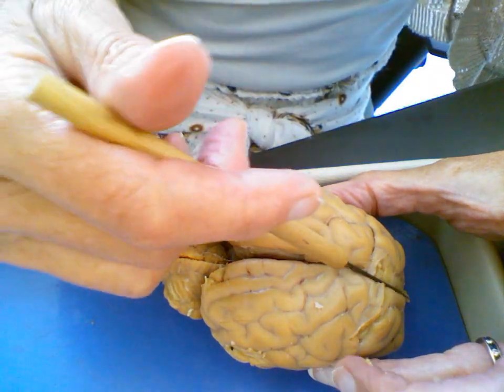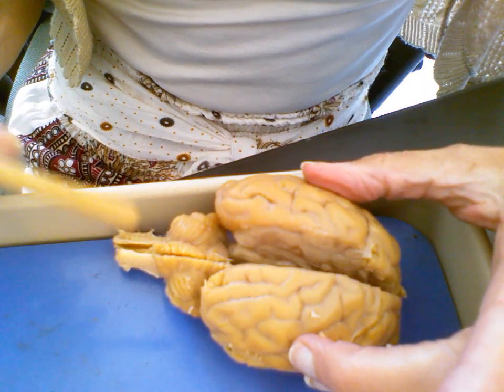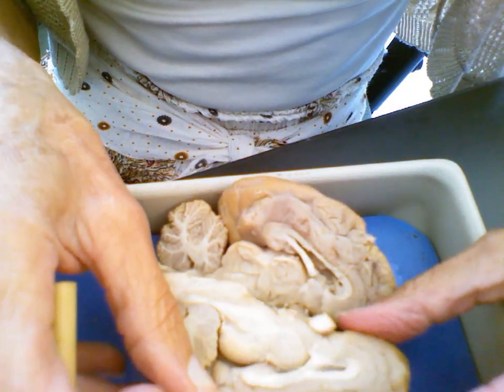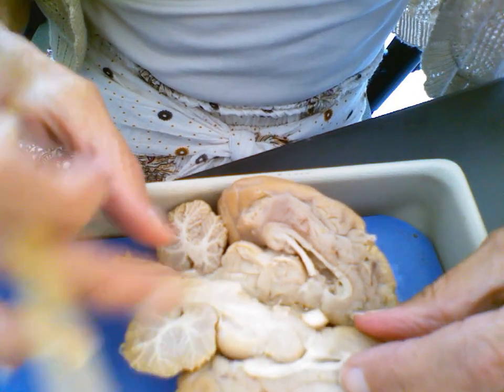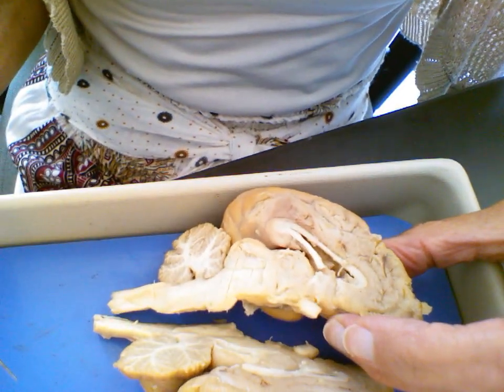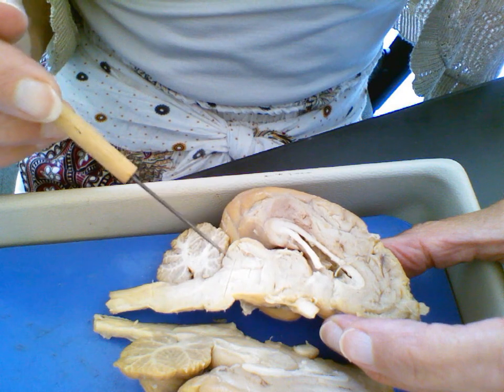Now, let's imagine that here we are with our scalpel, and we have cut through this medial longitudinal fissure. What we've done is effectively create two mid-sagittal sections of the brain. So let's take a look at these on the interior. So there's a mid-sagittal section. Let's see if I can put this in a central location so you can see it. This isn't quite as nice of a specimen as the one over there, so I may just start with this and then flip over to that.